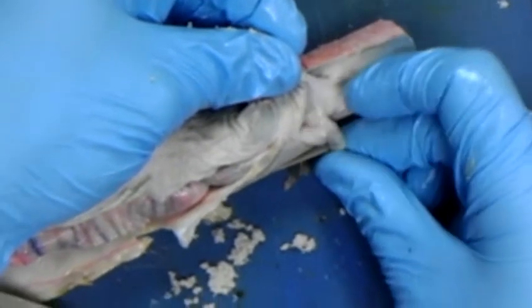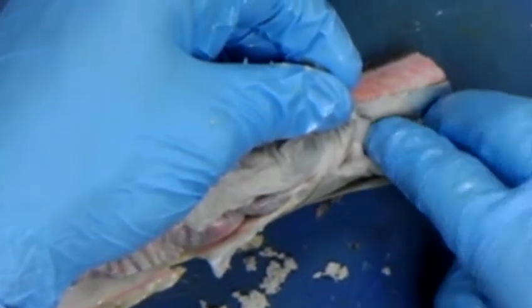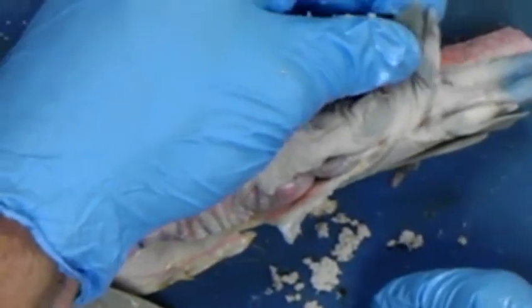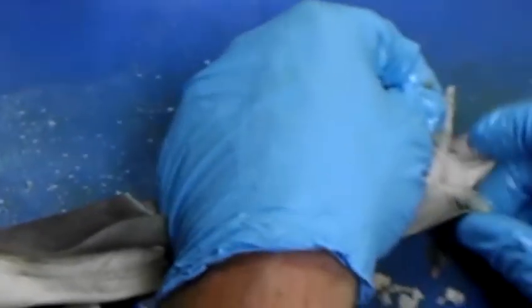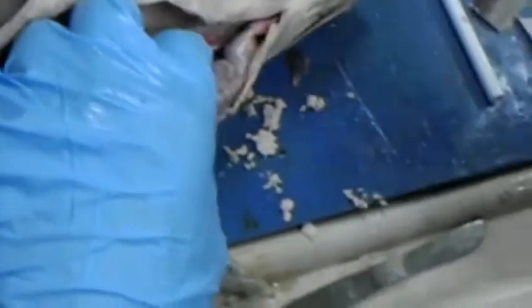But a cloaca is just that instead of having a urogenital opening and an anal opening like in the bony fishes, it's all contained in this one little fold called the cloaca. That is the digestive system. Food went in, we traveled, and came back out. And keep in mind, this is digestive waste that comes out. And then when we start talking about excretion, that's nitrogenous waste that comes out through the urinary tract.